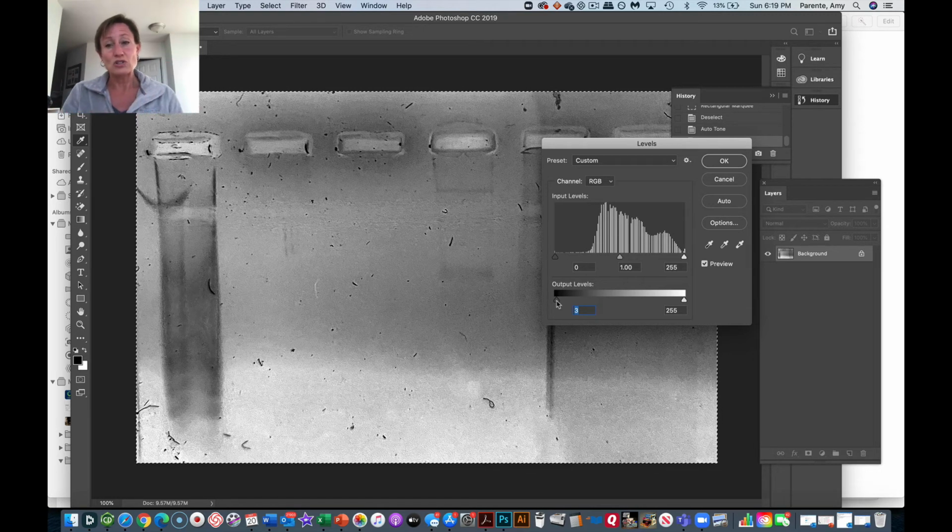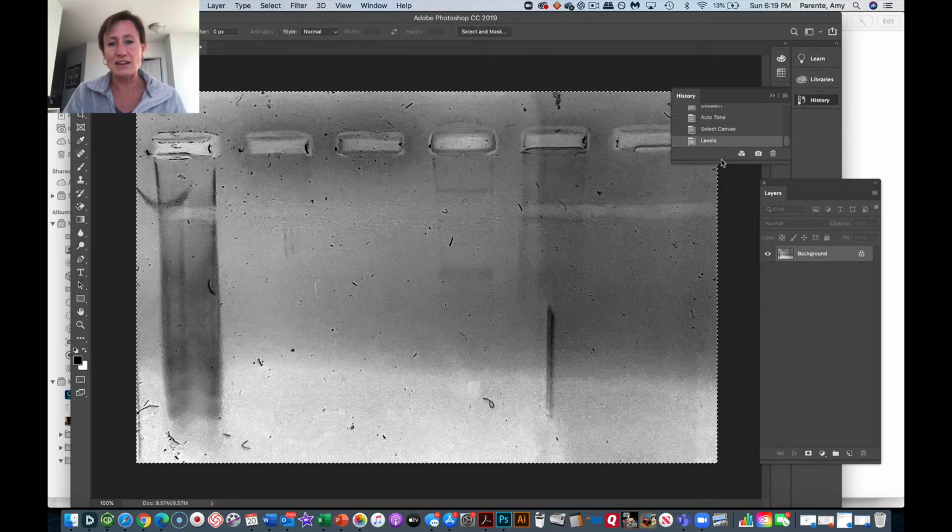Again, this is a huge thing because we have digital editing tools to do things now. It's really important that people understand the ethical implications of changing your data to look how you want it to. That's not what we want to do. So what I'm going to do is save this file, and what you guys are going to need to do is label the things that we have here.